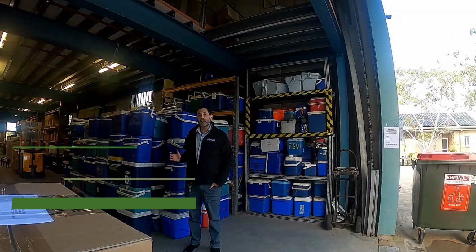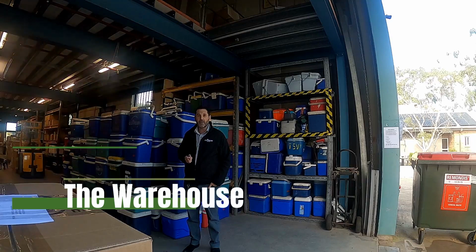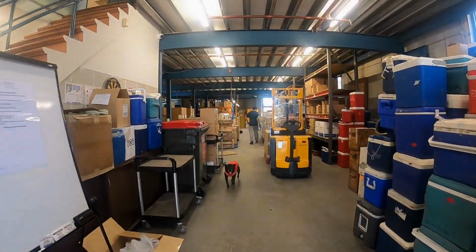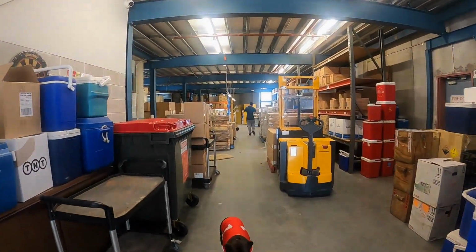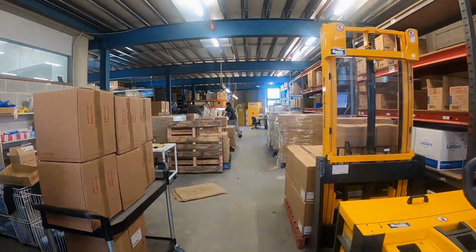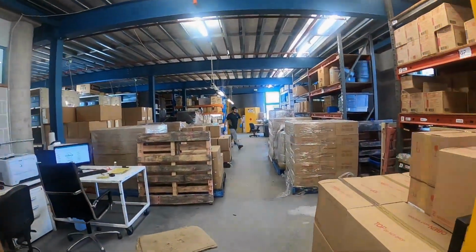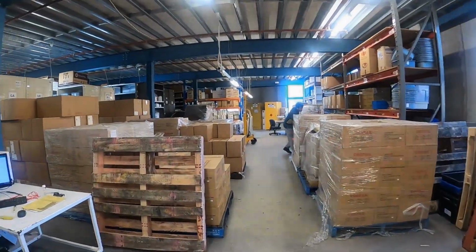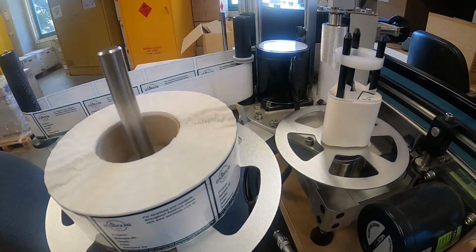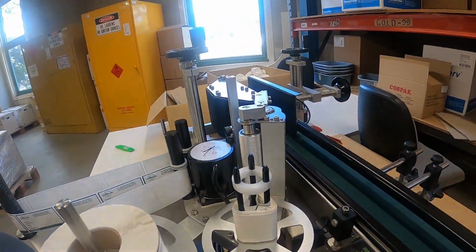So laboratories also have warehouses, and this is our warehouse next door to our main lab. Here we have a stack of eskies which we supply to our customers. Further into our warehouse is where we stock all our lab consumables, jars and bottles for clients. And during COVID, while most people were hoarding toilet paper, we built up our stockpile of over 10,000 sampling jars ready for our customers.